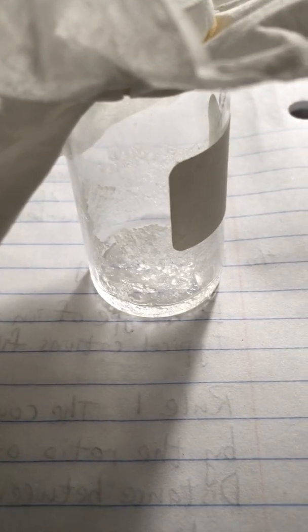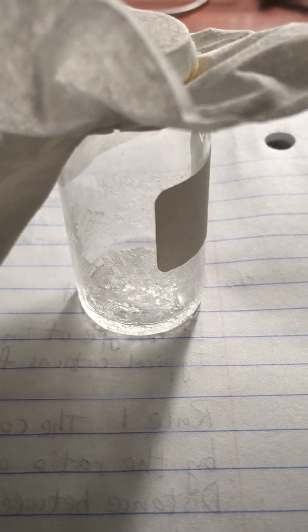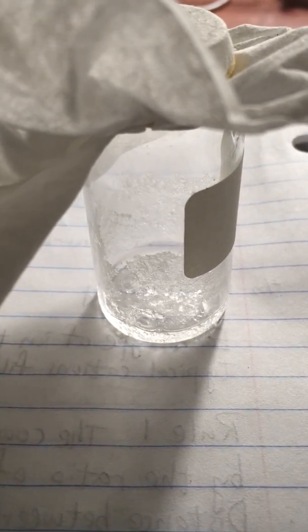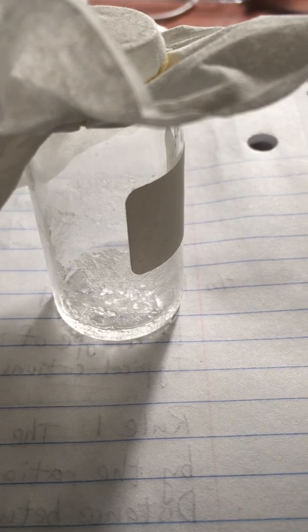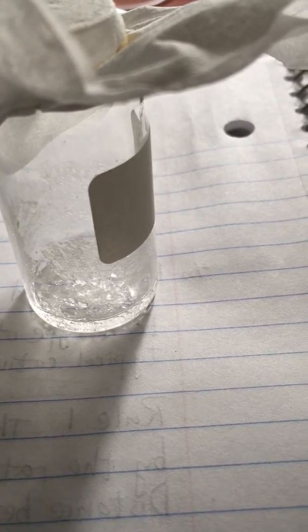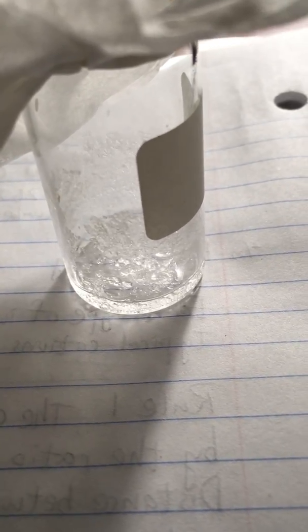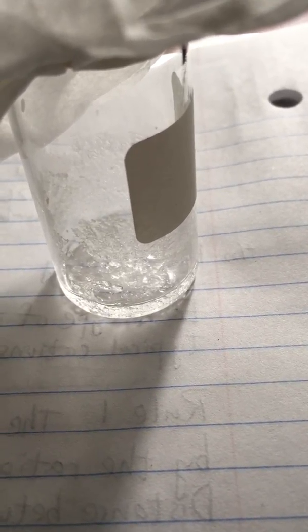I got some scattered crystals instead of a huge crystal, but I mean it's worth a shot. Anyways, how do you grow a crystal from a saturated alum solution? By slow evaporation, because with slow evaporation, a crystal will start growing at the bottom of the little vial, and then slowly but surely nucleation takes place, and more crystals will start gathering around the nucleus crystal, so the crystal will generally become bigger and bigger instead of all those scattered small particles. Slow evaporation essentially prevents too many small crystals from growing.